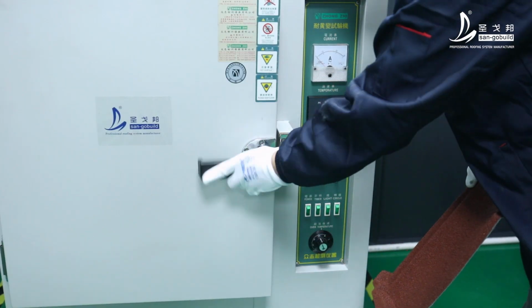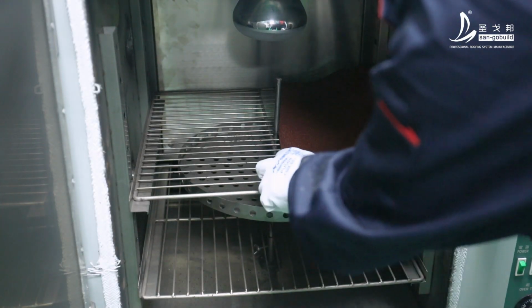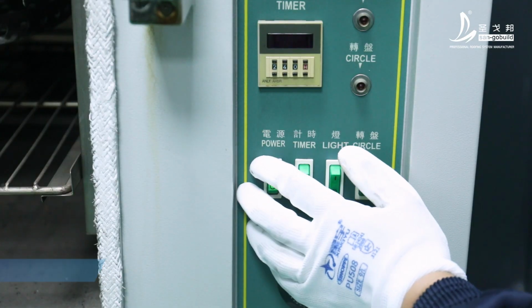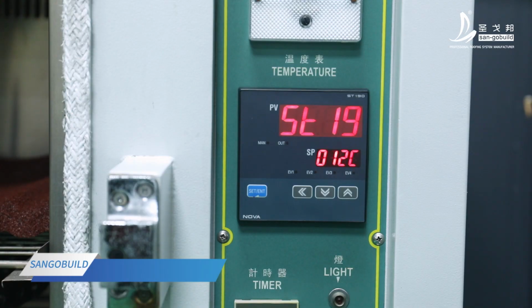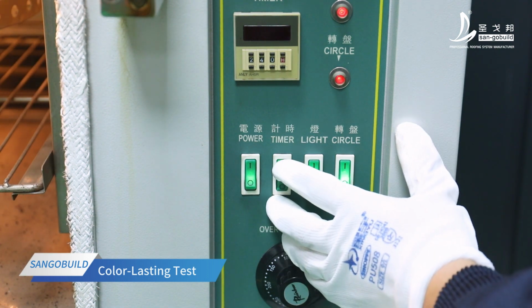Send the cut sample to the stone-coated roof tile laboratory. The laboratory technician carries out a yellowing resistance test on the sample. Put the sample into the machine. Start the machine for testing.